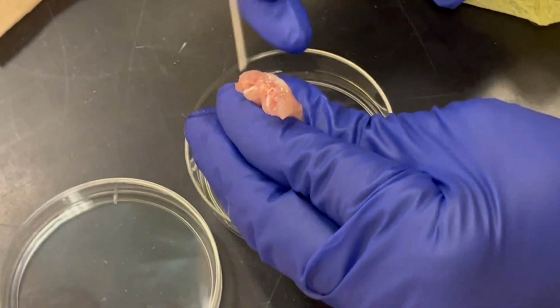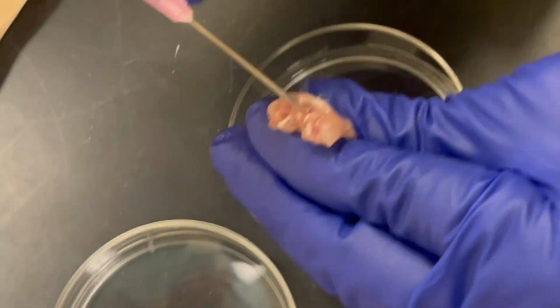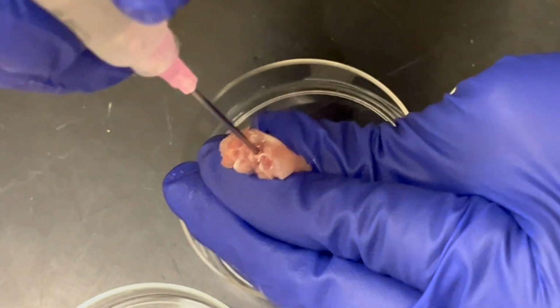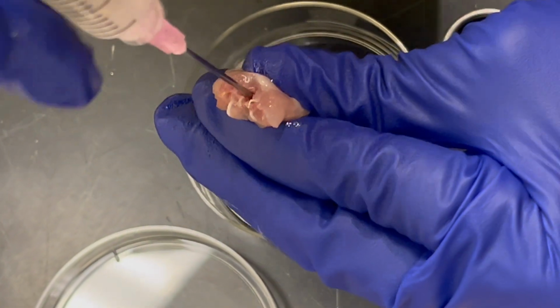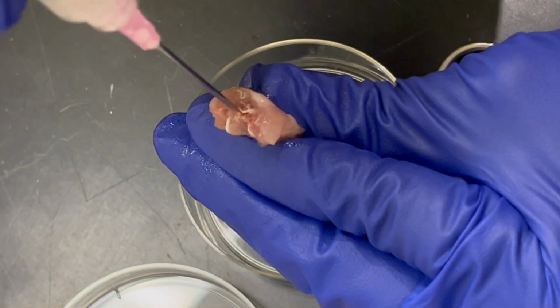How do you know? This is pretty dark. Do you see this? Yeah, there's a hole over here. The wire hole. This is where I'm going to try getting into. How deep do you go with your needle? I'm already in the wrong place, so don't touch me.